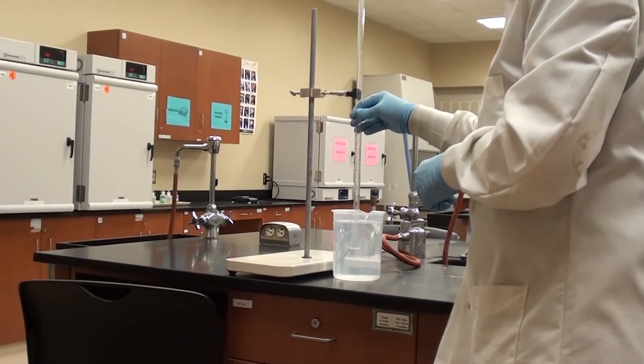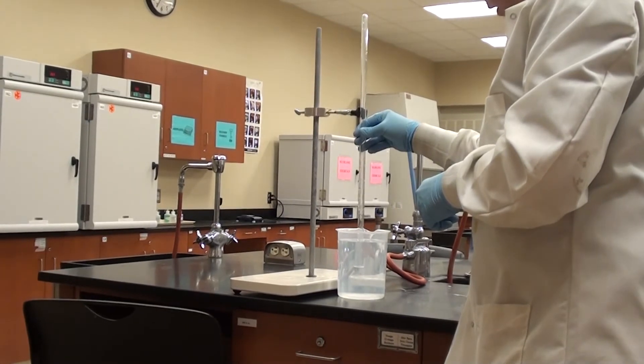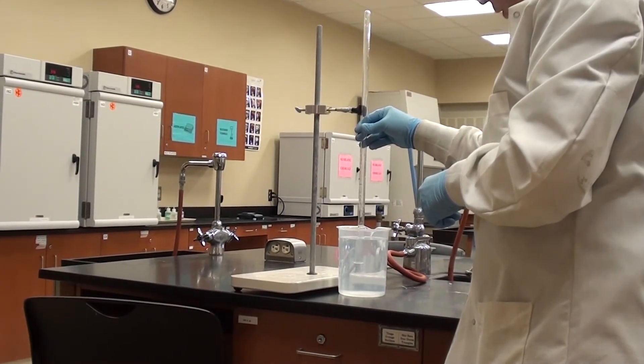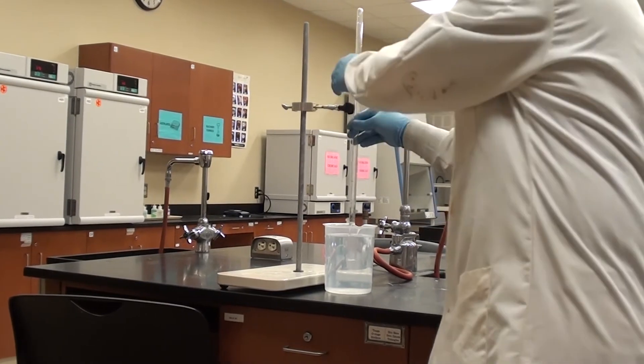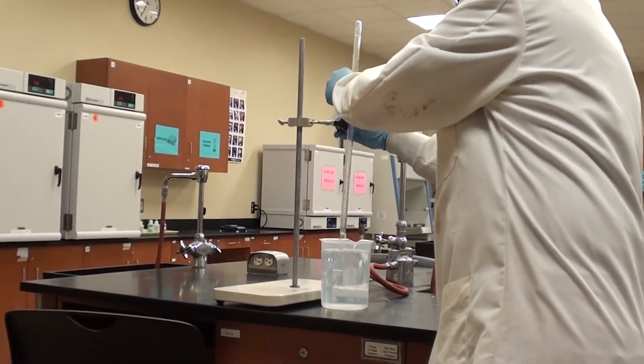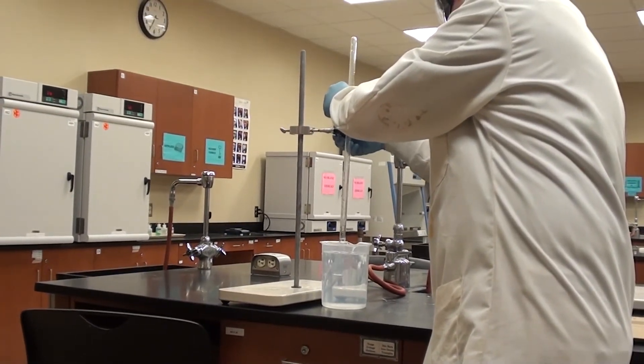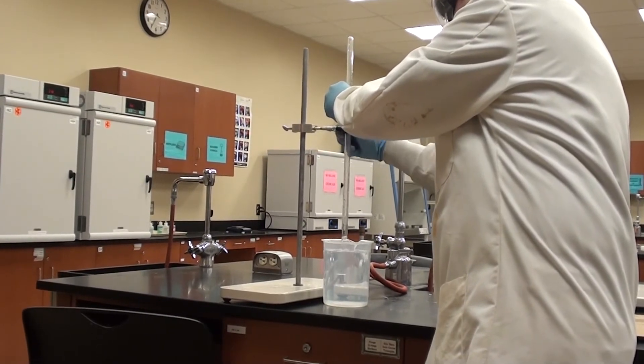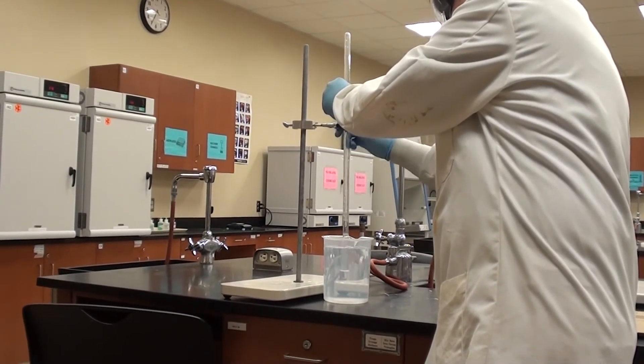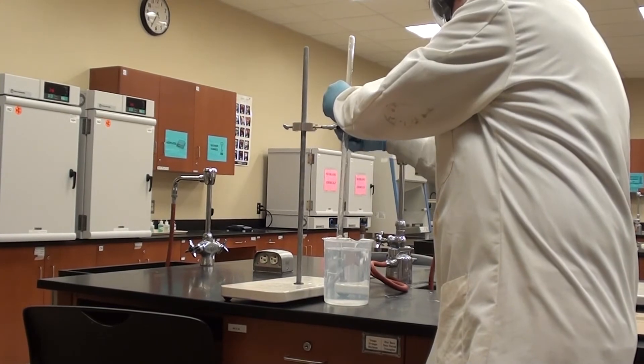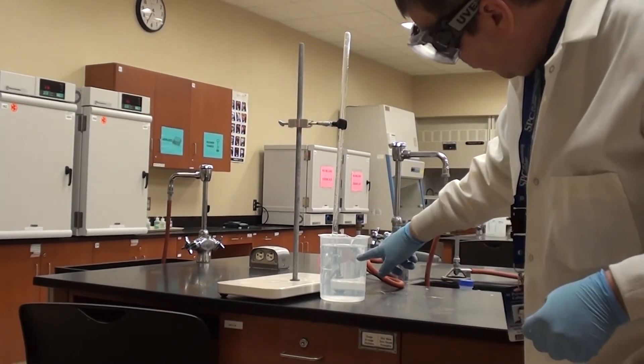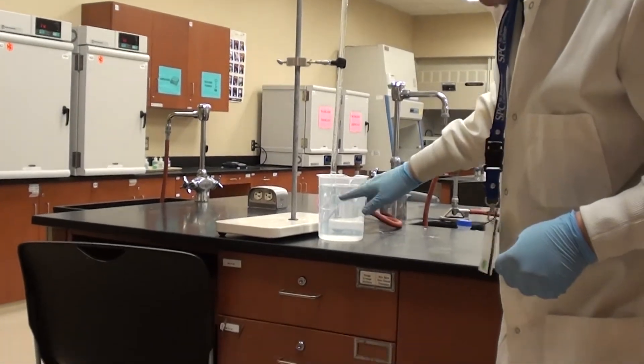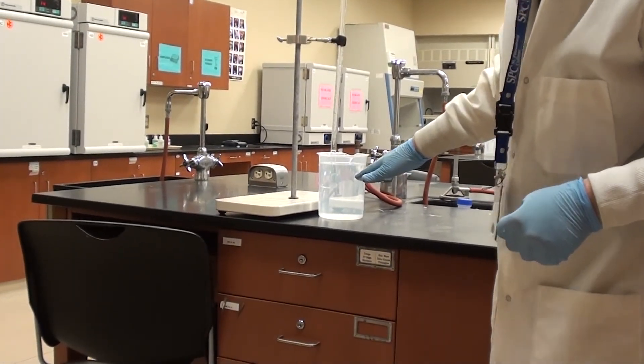Now as long as we've layered this properly, then the HCl should be concentrated enough to dissolve all of that magnesium that was in there. Alright, I'm going to go ahead and clamp this, making sure, very sure, that the level of the water is above the level of the eudiometer tube, the open end. So that has to stay under the water the entire time.